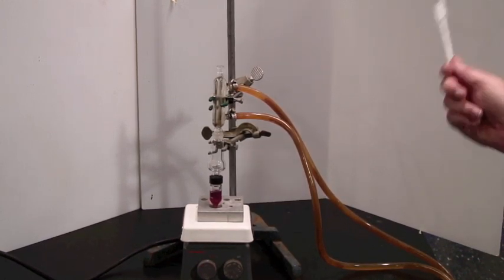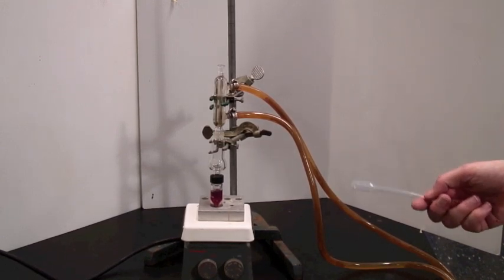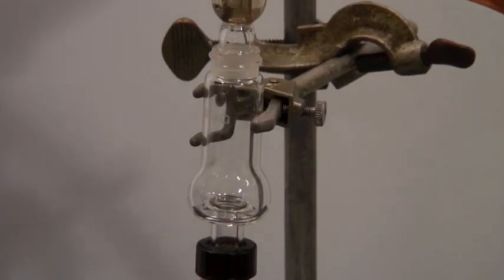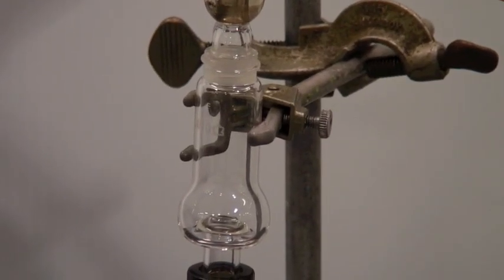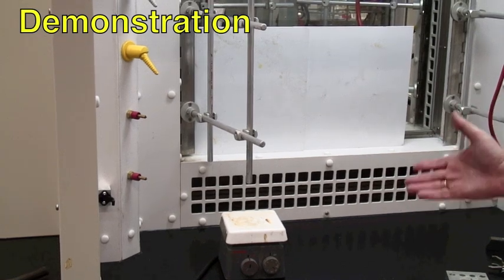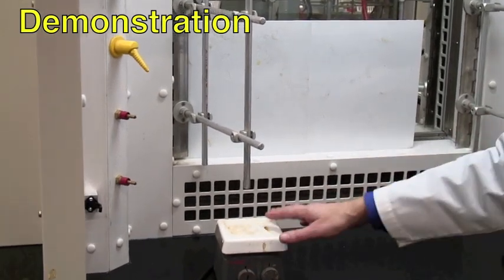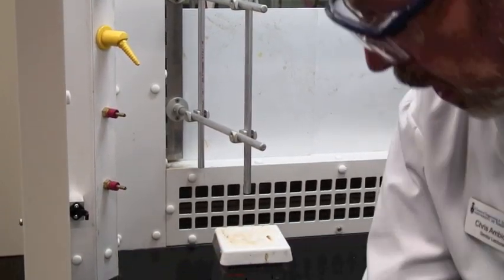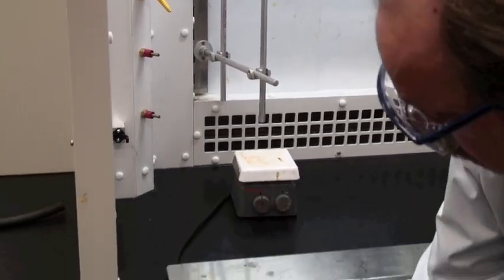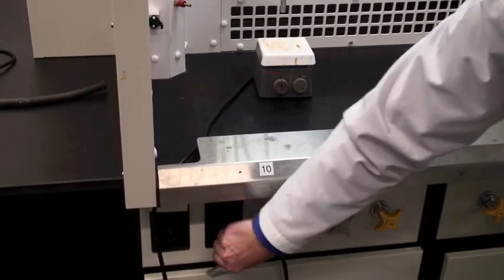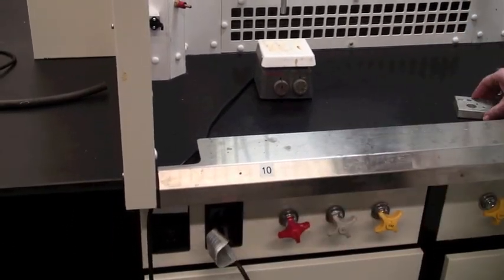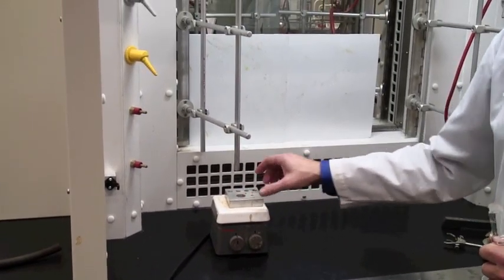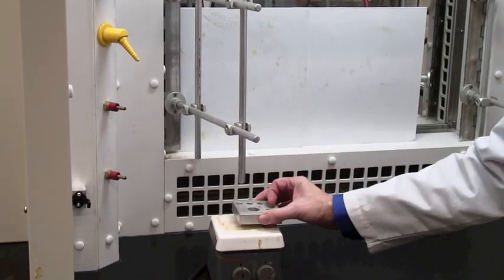That's how it looks by itself. Let's actually put it together in a fume hood and do an actual distillation. So let's put these together in a fume hood. We'll start off with a hot plate, and don't forget the power cord goes down the side before you plug it in to minimize the spaghetti that is going to appear in this fume hood very shortly. Put your heating block on top and try and get the well as close to the center of the hot plate as you can.